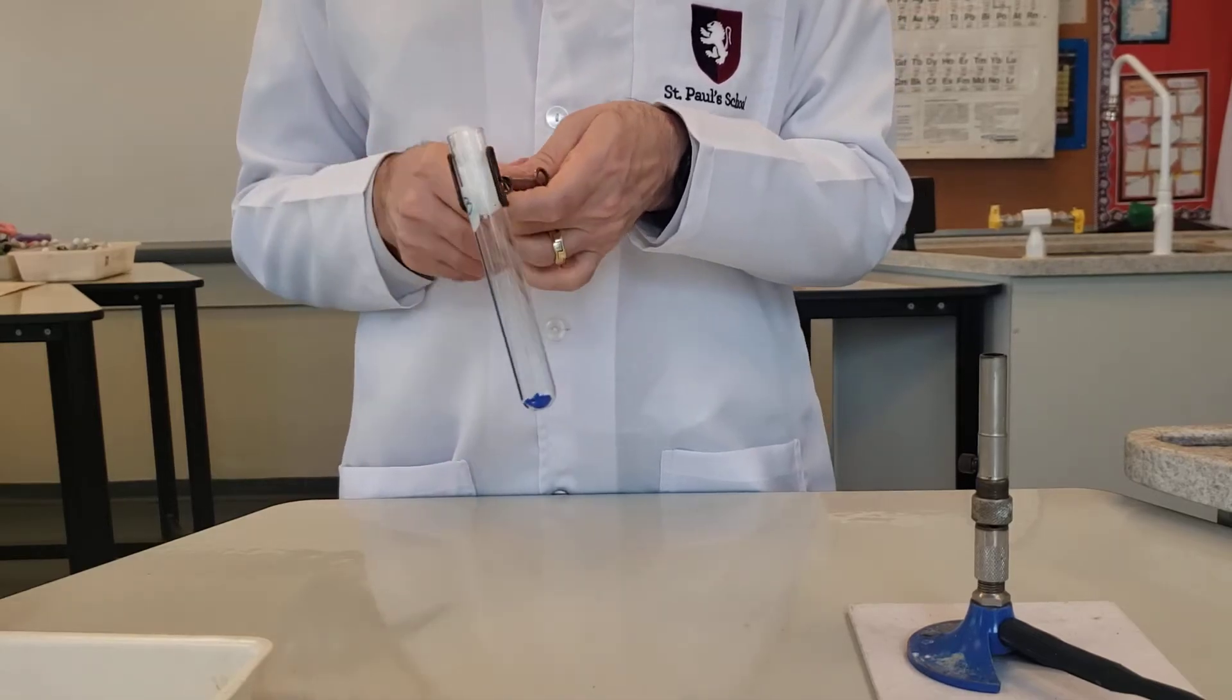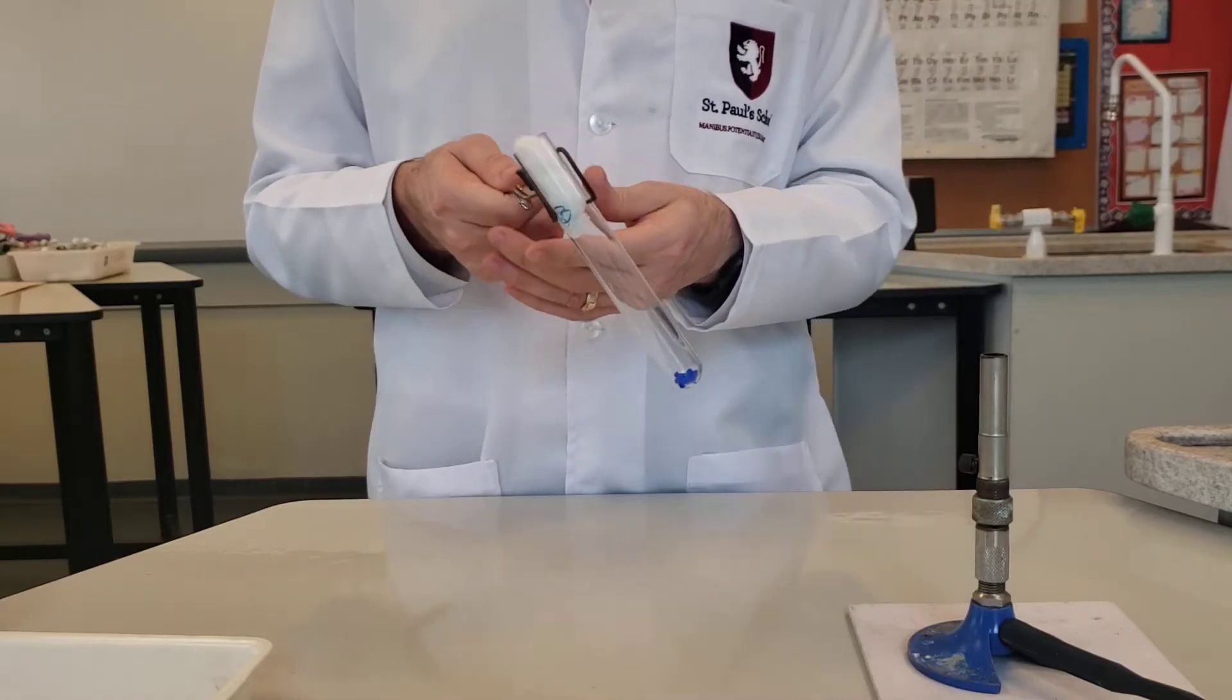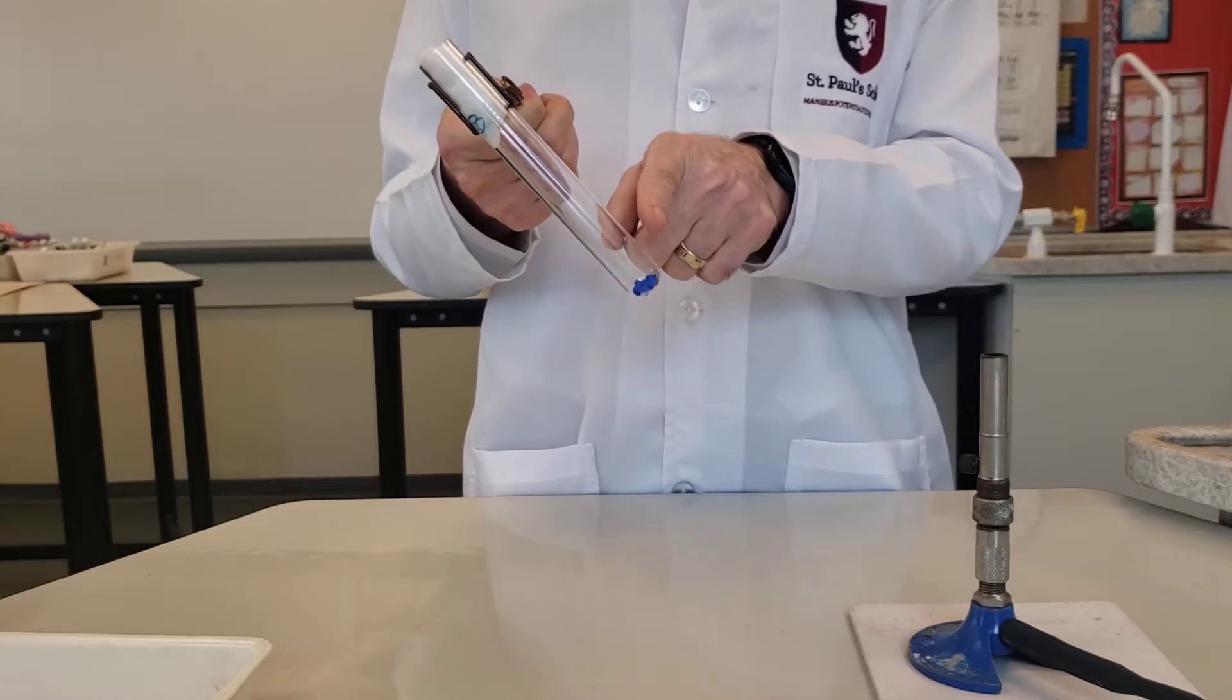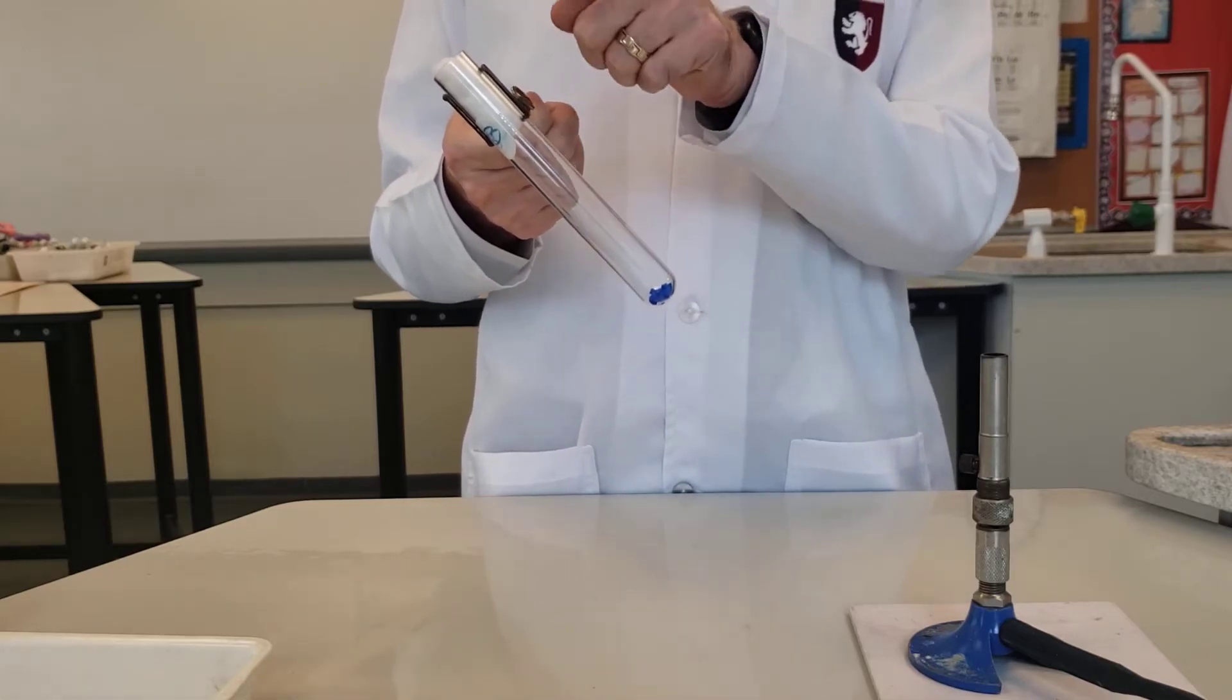Quite a lot of things are going to happen in this thermal decomposition, so pay close attention to what's going on with the crystals and also anything else that might be forming inside the tube.